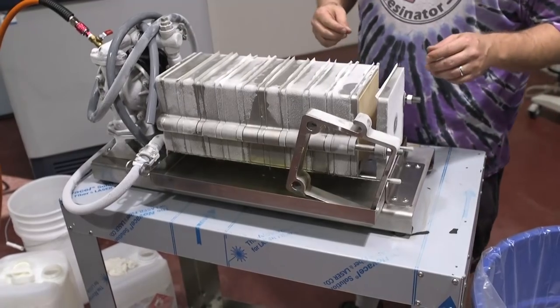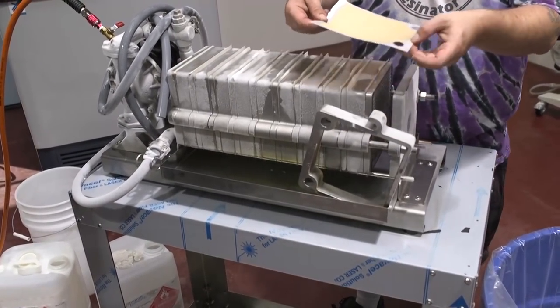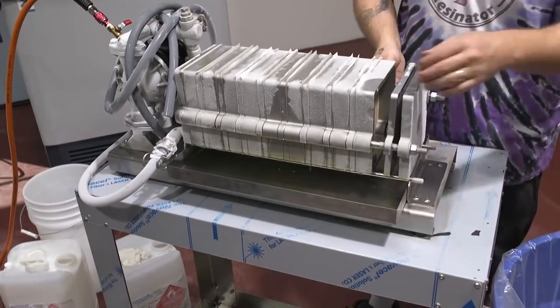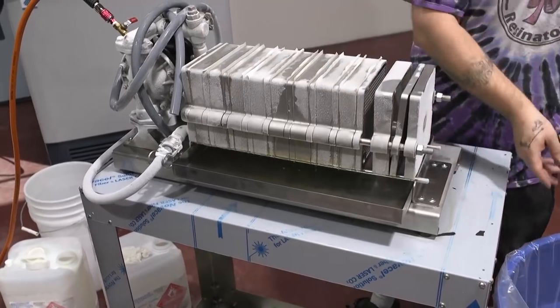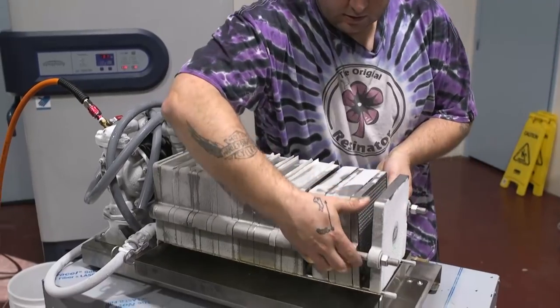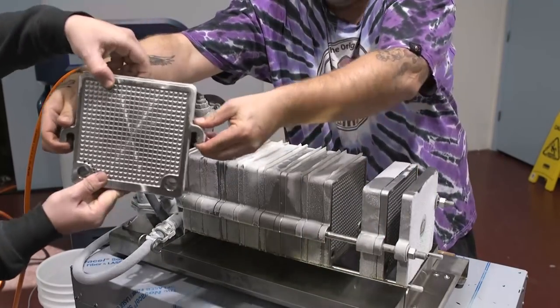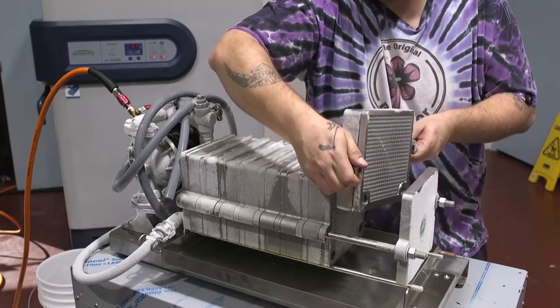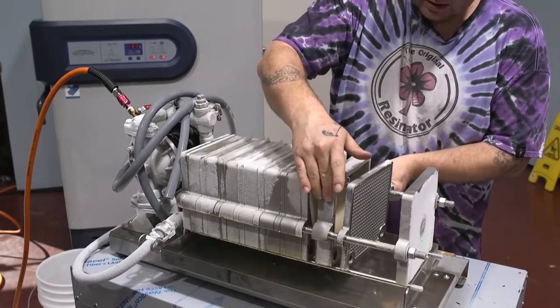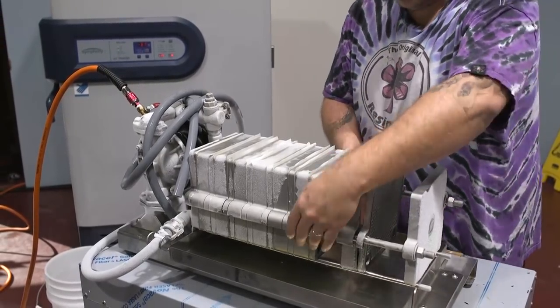This is going to be really interesting to see what happens with the papers. Starting with the last paper in the unit — second to last, you can start seeing some real buildup here. Again, completely layered at high speed filtration. As we get closer, we're going to start seeing actual cake on the plate. They're really cold right now, so it's kind of difficult to deal with. We just ran about 20 gallons — maximum 20 gallons of fluid — through this system, maybe even a little less.